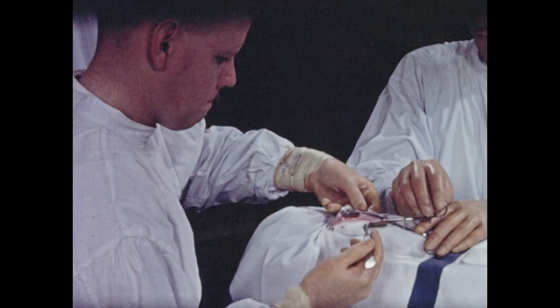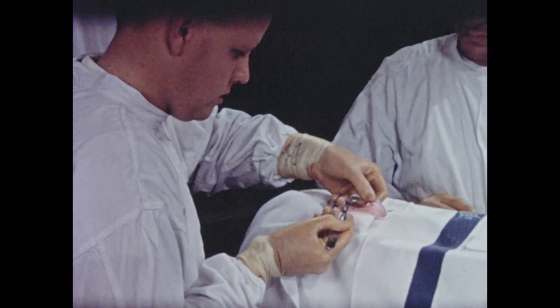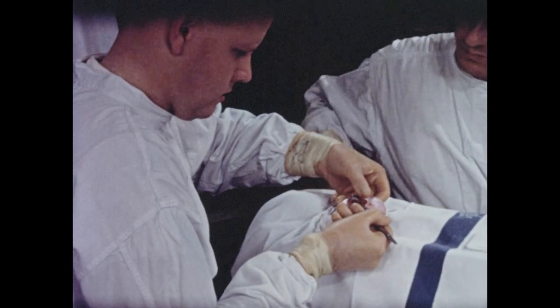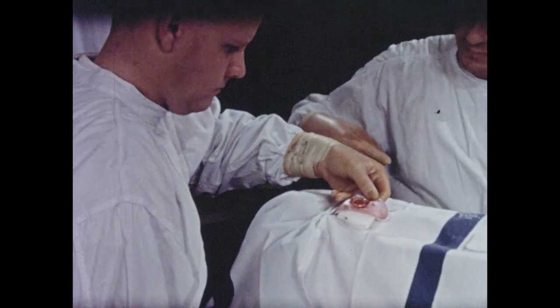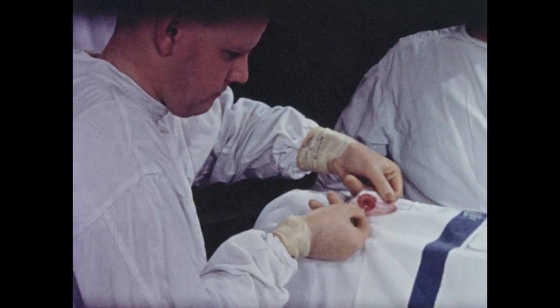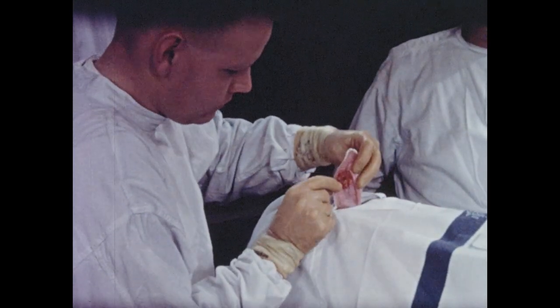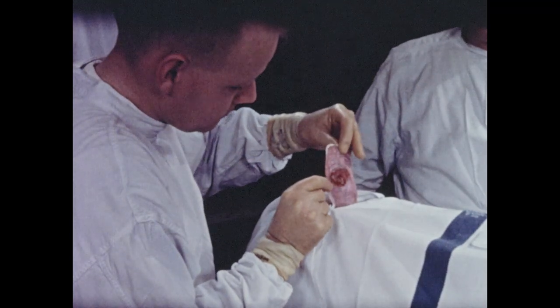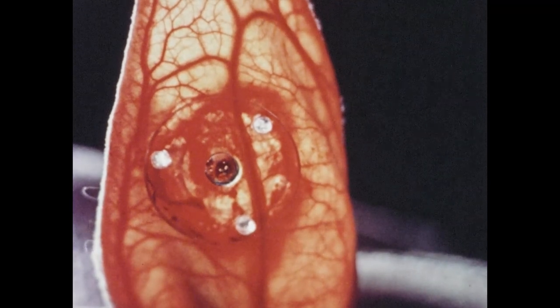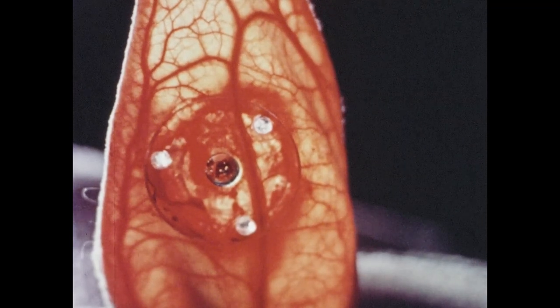About an hour later, the clamp is removed. The pressure plate is then carefully freed from the circular plastic ring. Finally, the installed chamber is carefully examined. Postoperatively, the animal receives penicillin during the next two weeks. Approximately six to eight weeks are required for this blood clot in the central observation area to be replaced by fully mature blood vessels and the tissue to become free of cellular debris.